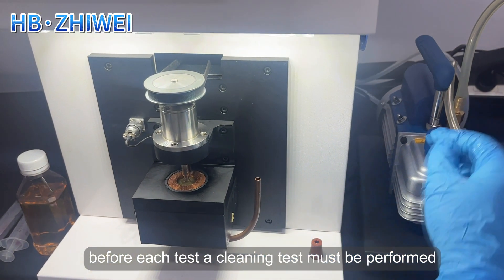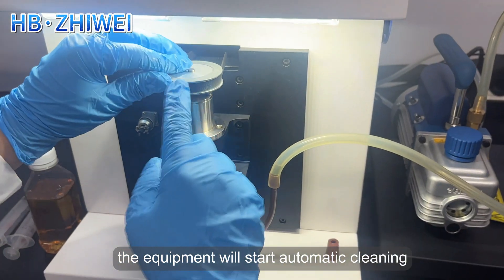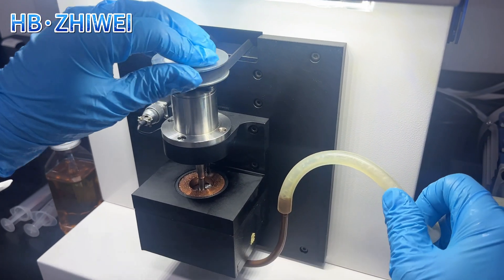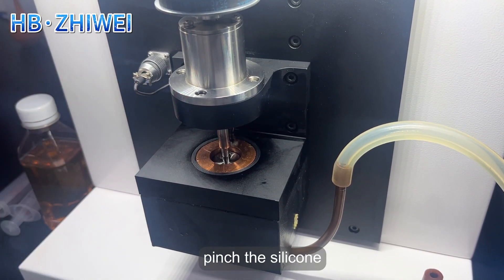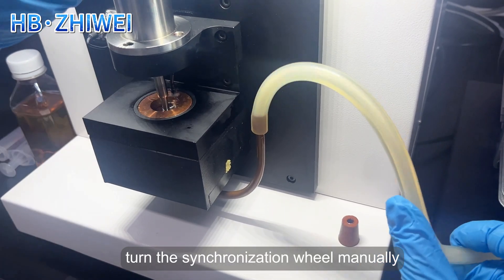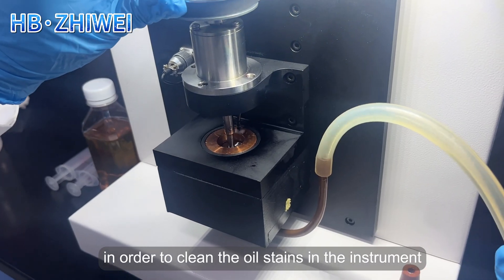Before each test, a cleaning test must be performed. Open the oil filling port, insert the silicone tube of the negative pressure pump, and then click the negative pressure pump on the screen. The equipment will start automatic cleaning. During the cleaning process, manually turn the synchronous wheel counterclockwise to clean the stains on the operating table. Inject petroleum ether to fill the stator cup without overflowing, then pinch the silicone tube of the negative pressure pump. Loosen the tube, turn the synchronization wheel counterclockwise again, and inject petroleum ether to fill the stator cup again. Repeat this operation two to three times to clean the oil stains in the instrument.